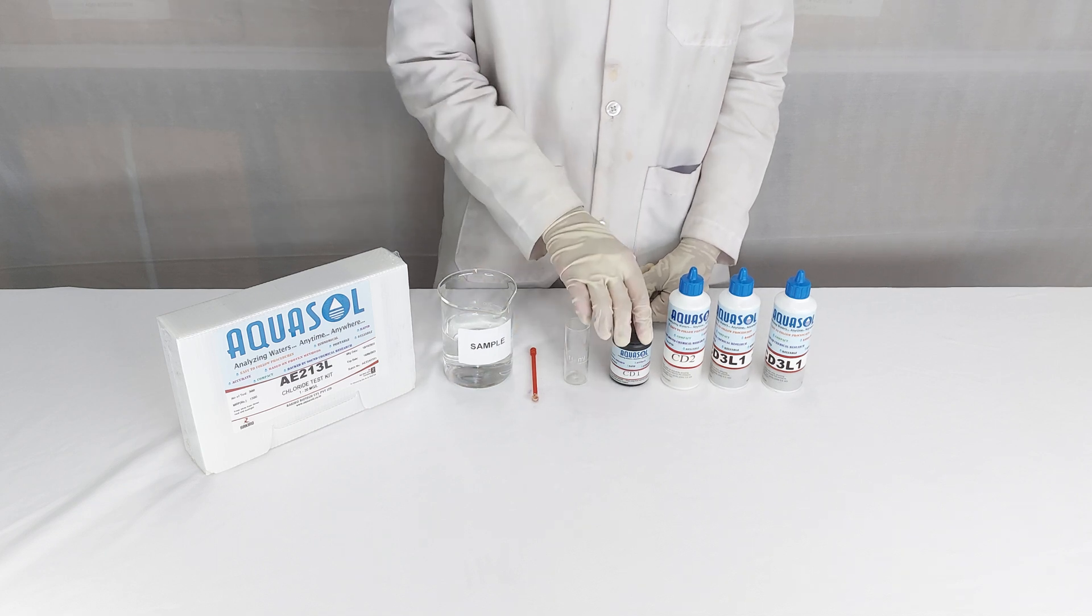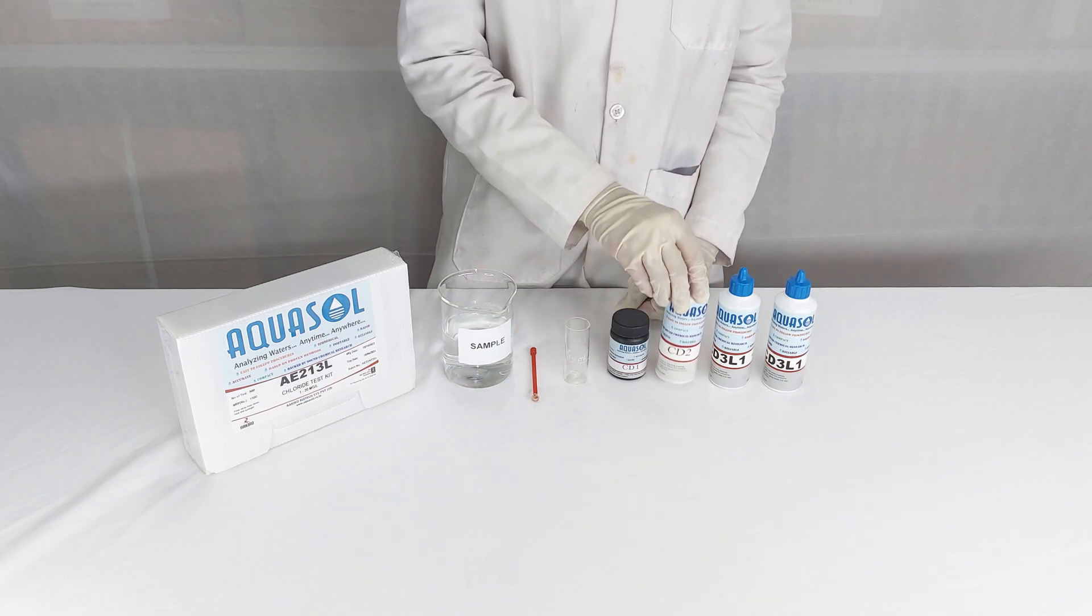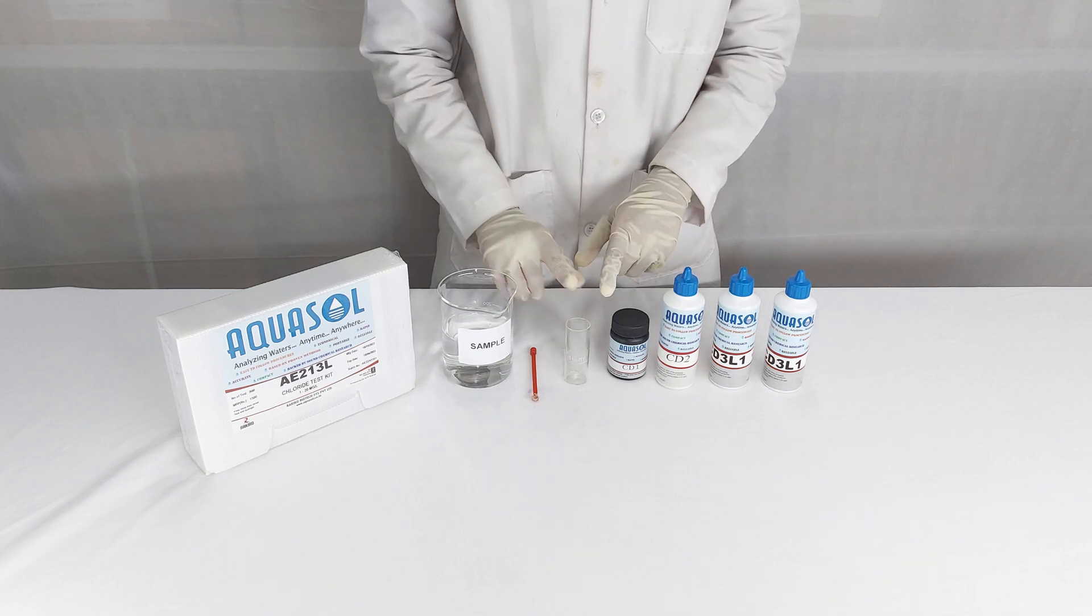The kit contains reagent CD1, CD2, CD3L1, a test jar, and a spoon.